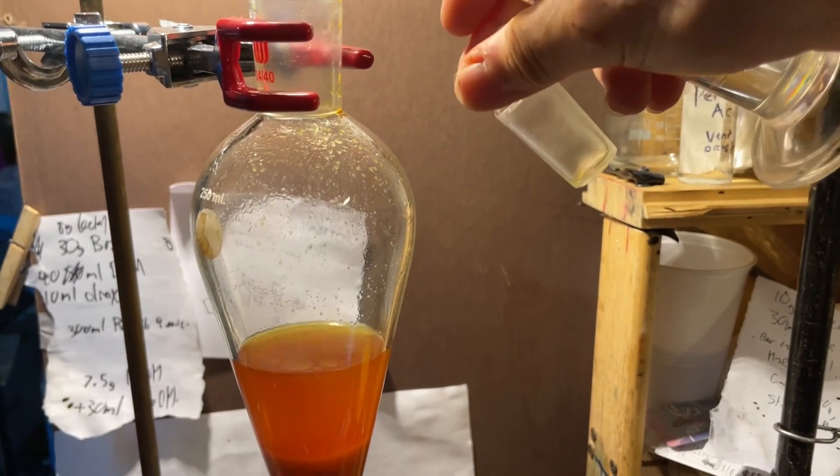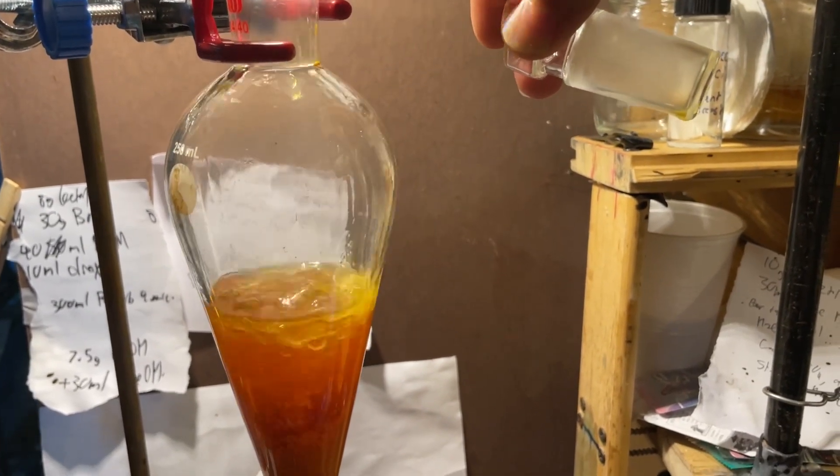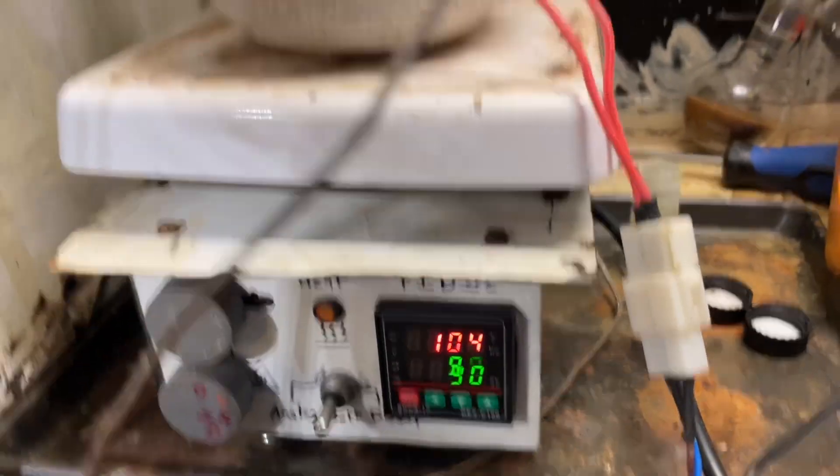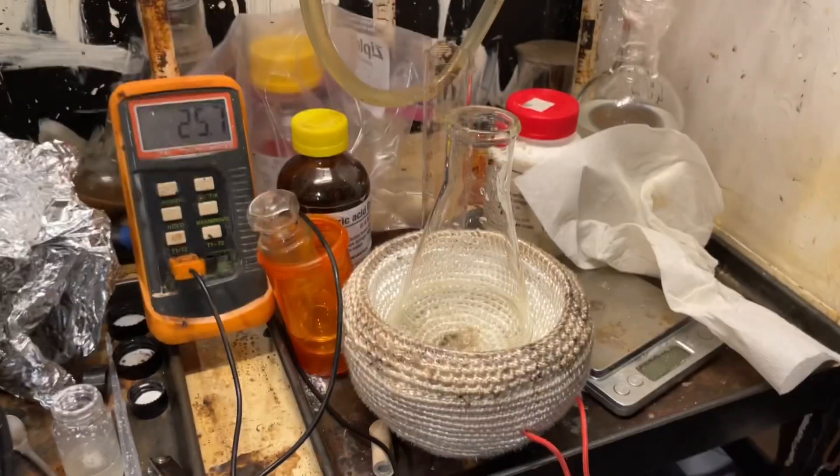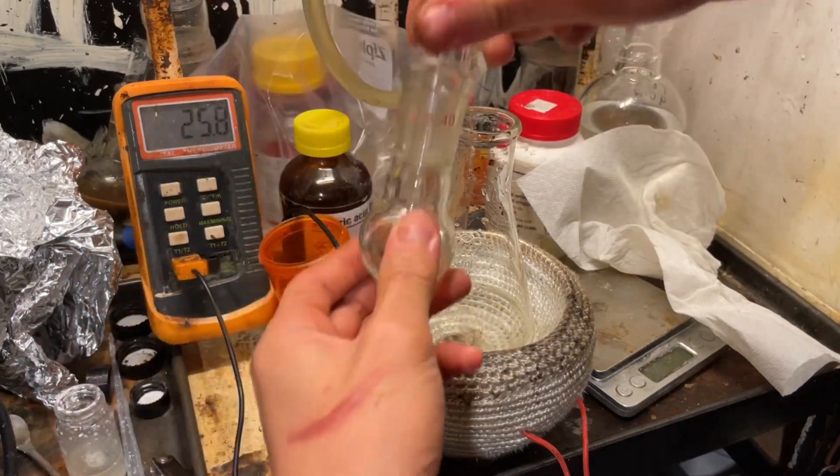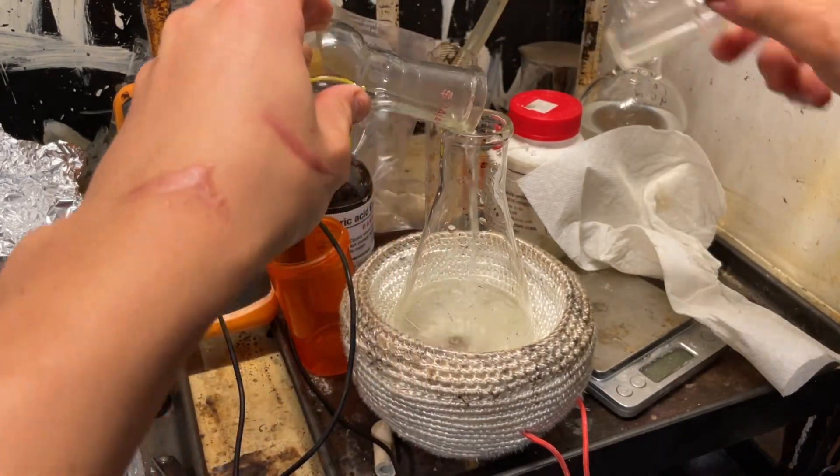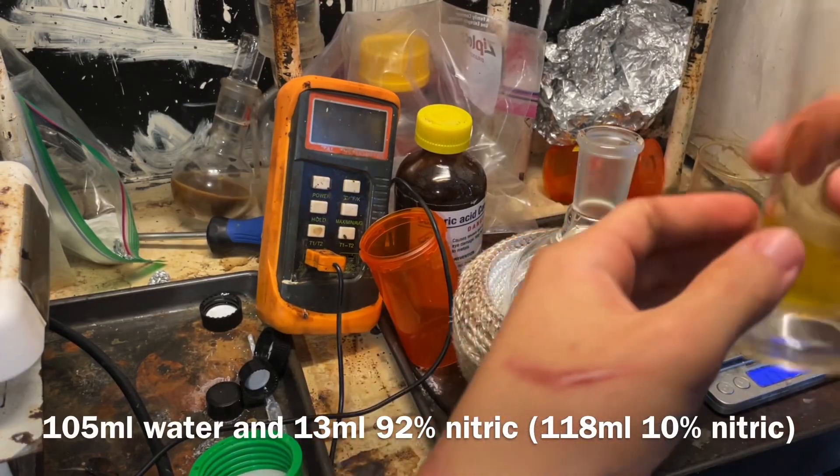You can see here what I mean by mess it up. I used a sodium hydroxide trap to destroy the nitrogen dioxide, which was formed in this reaction. And it sucked back, of course. So anyways, I tried to extract with toluene to yield something, but the benzaldehyde I got was a miserable amount, so this run was considered a failure.